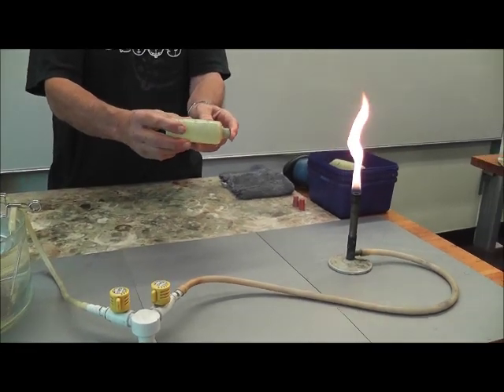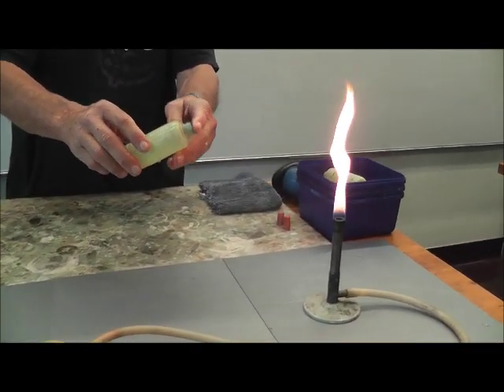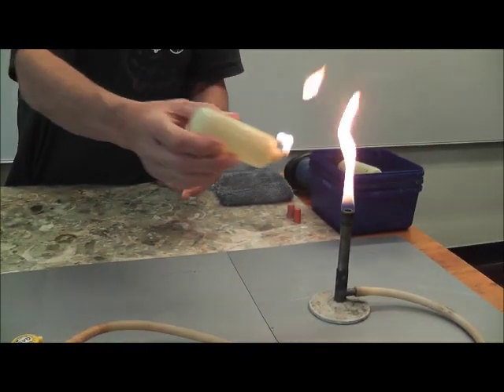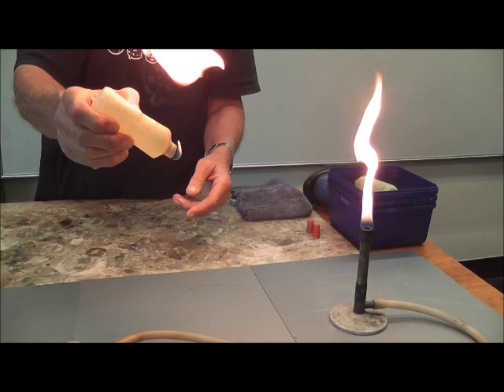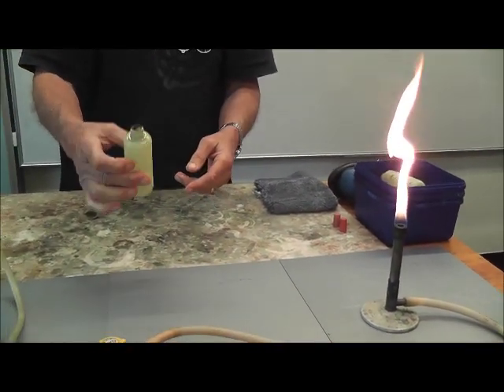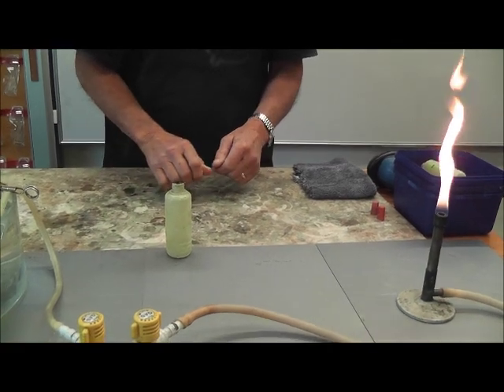So we'll try and burn that. Now remember propane is a gas heavier than air. So to do the combustion we allow the gas to run out, and it burns quite nicely in the air. Nothing very spectacular. Quite an ordinary combustion.